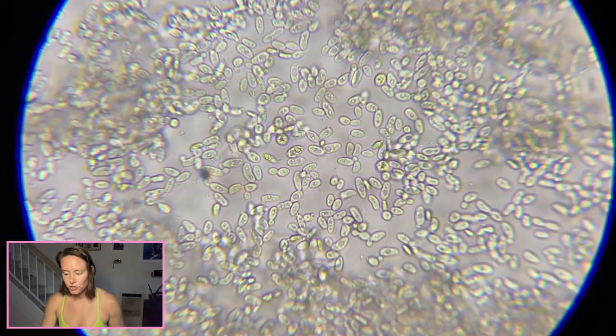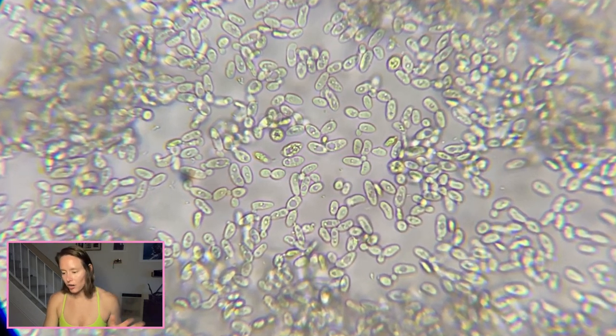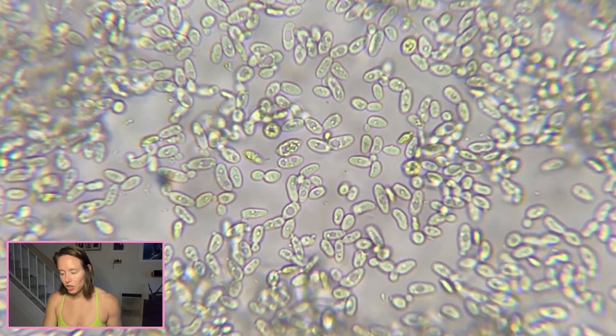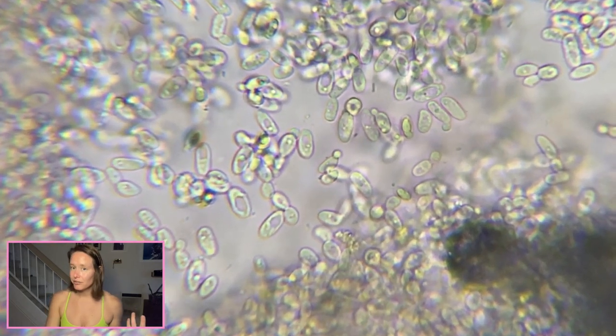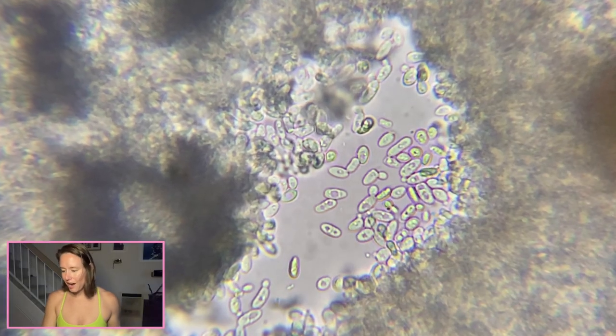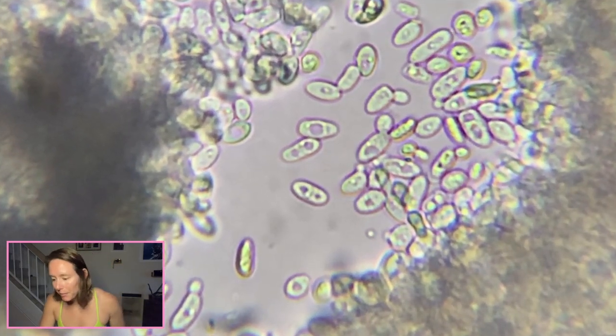Similar to what we saw with the experiment using RC212, there's a lot of oval-shaped, slightly elongated budding yeast here. Some of them have pretty large vacuoles, which is different from the RC212. But then some of those that have a pill shape almost seem like they have a fission line dividing them. So are those fission yeast? I'm not entirely sure, but maybe.